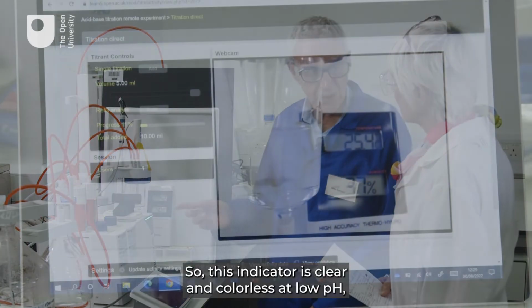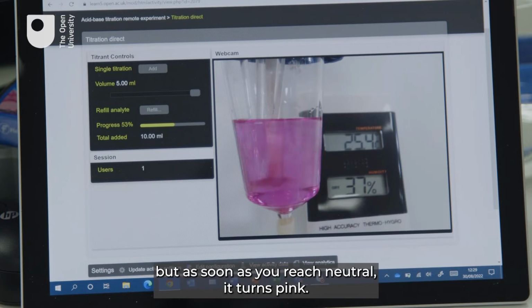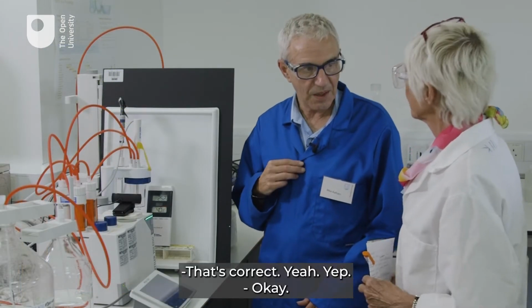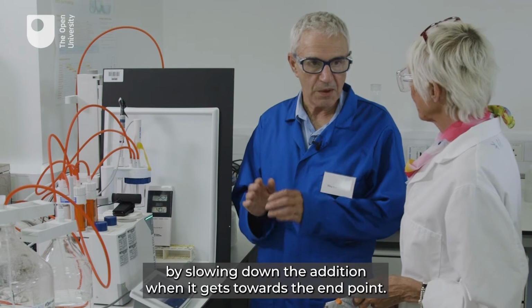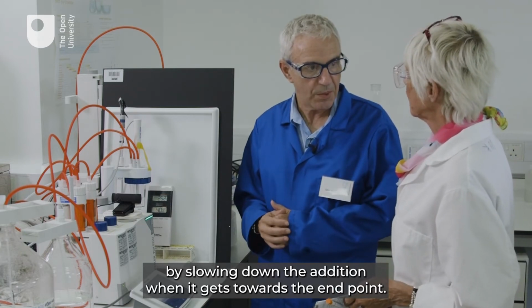So this indicator is clear and colourless at low pH, but as soon as you reach neutral, it turns pink, and that's what gives the pink colour at the end. And that's the end of the experiment? That's correct, yep. So then they would repeat it, but this time doing it more accurately by slowing down the addition when it gets towards the end point.